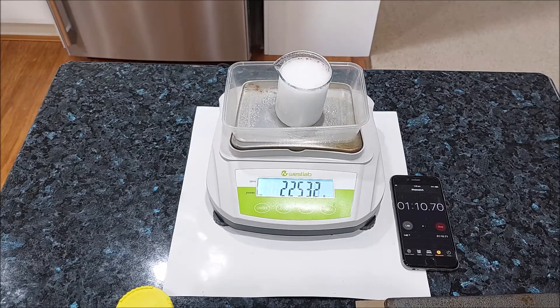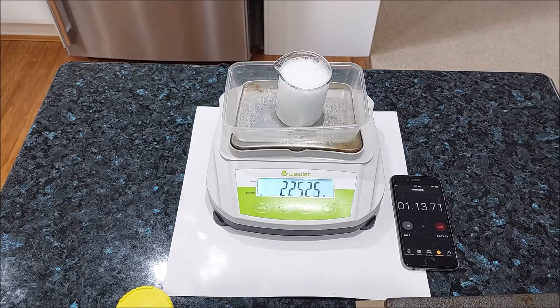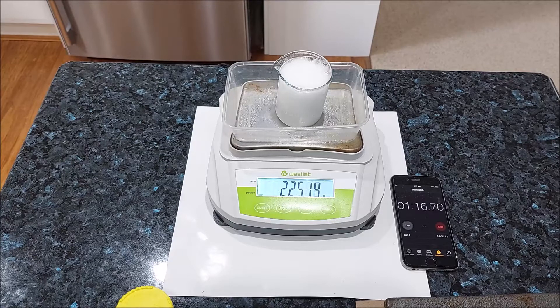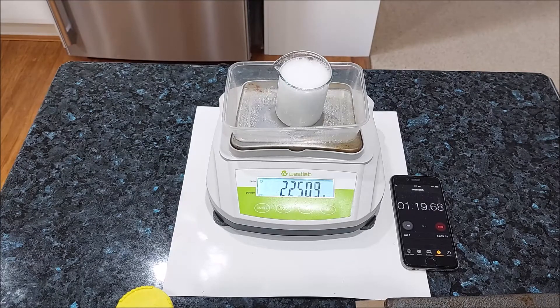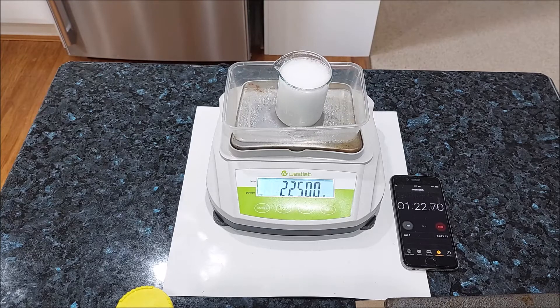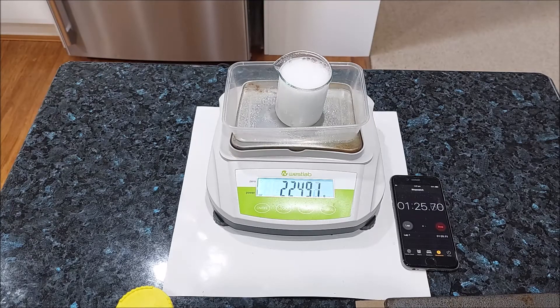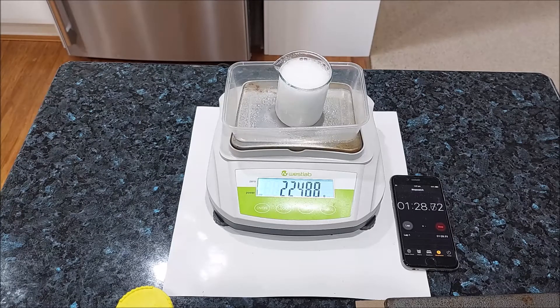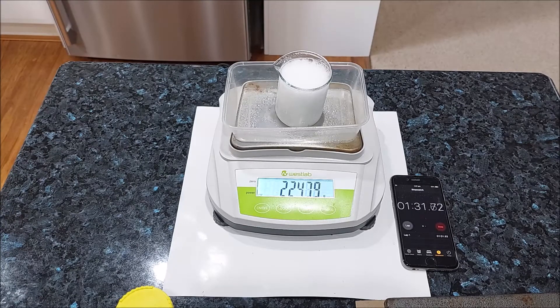I think my beaker's going to hold until the end — it's getting close to overflowing though. 30 seconds left in the experiment.